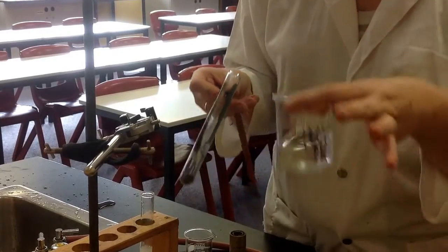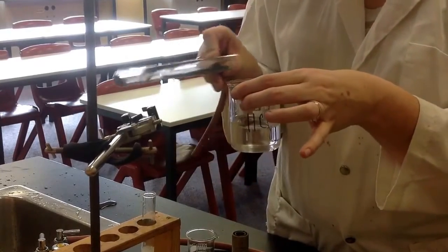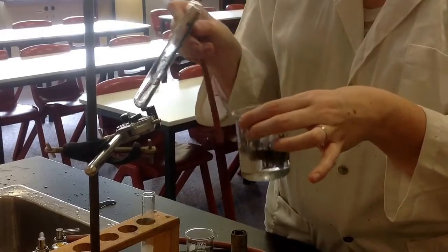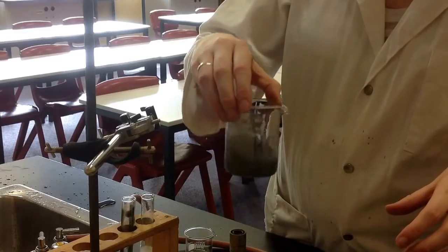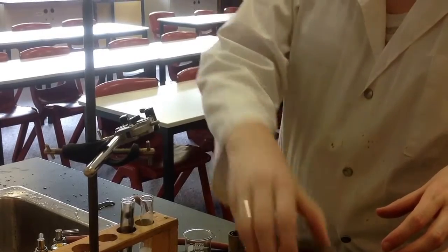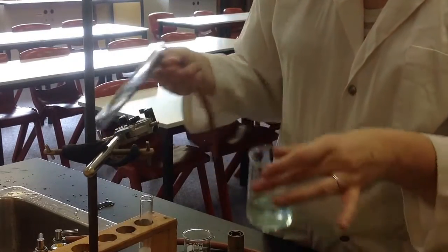And if I do the same thing with hydrochloric acid, put some powder in, fizzes, remember it's really hot too. I should see a different color coming up, again a blue color. Let me put some more back in here.